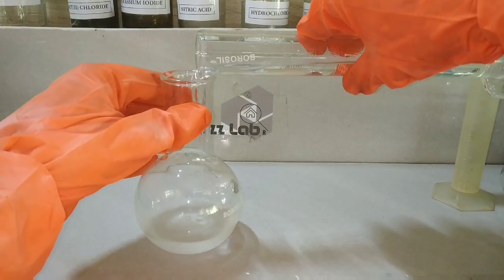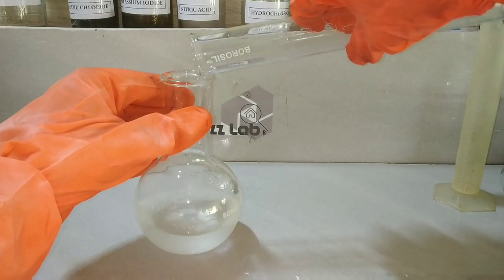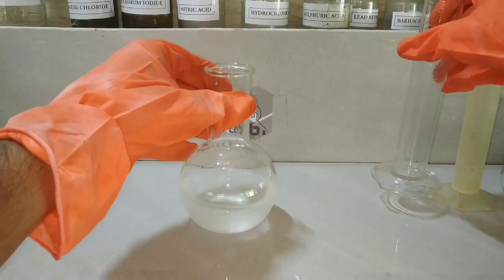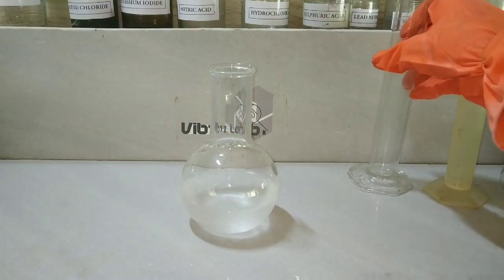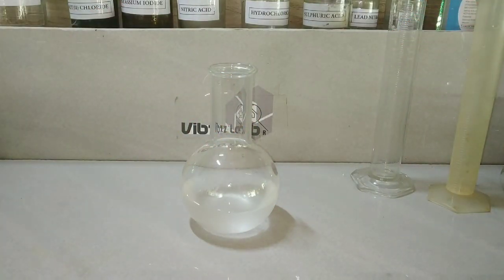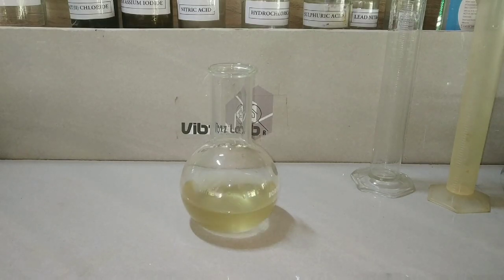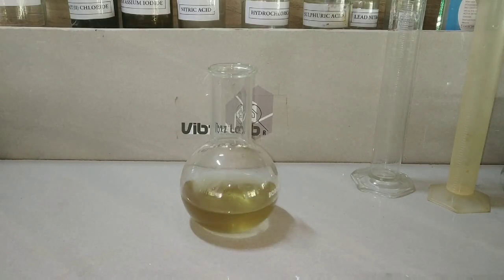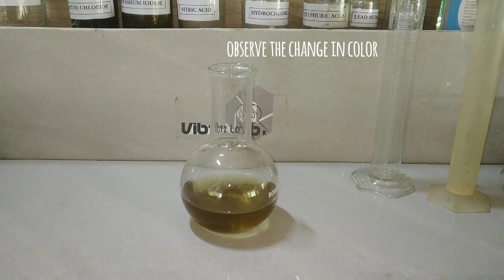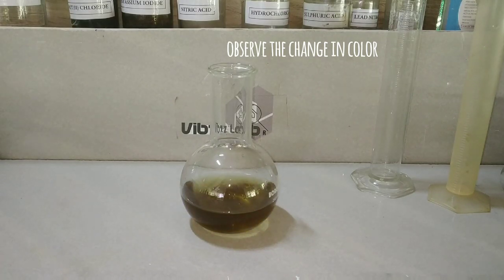Now I am adding solution 2, which contains approximately 25 ml of 1 molar sulfuric acid and 25 ml of 3% hydrogen peroxide. On mixing these two solutions, you can see that there is a color change after some time, and the color is turning darker and darker.